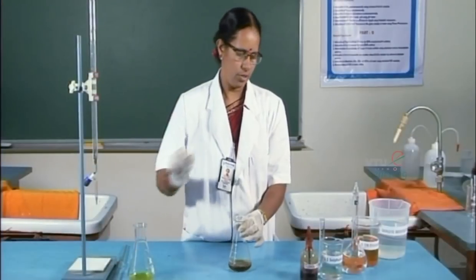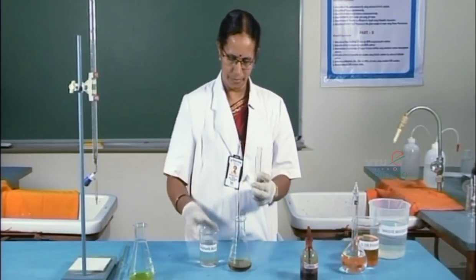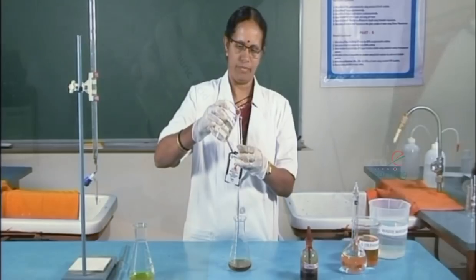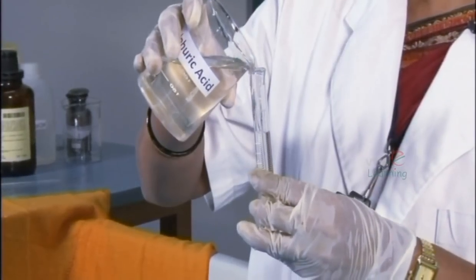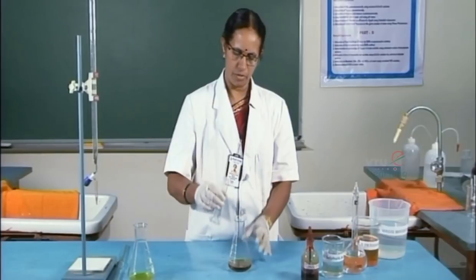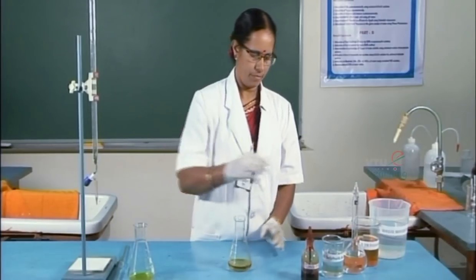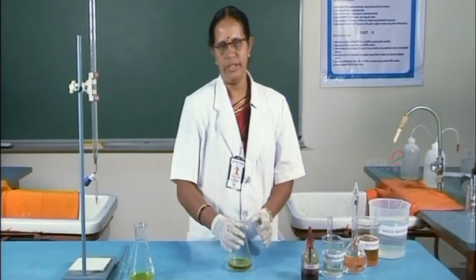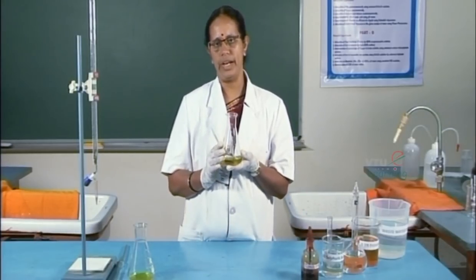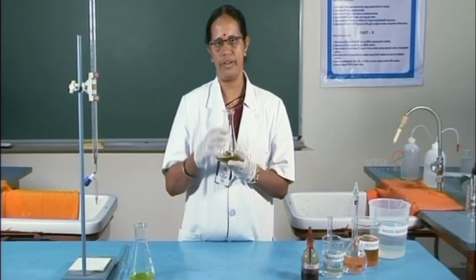Now, to this, 1 is to 1 sulphuric acid is added — about 10 ml of the acid is added. To the contents of the conical flask, boiling chips are added and the solution has to be refluxed for half an hour.